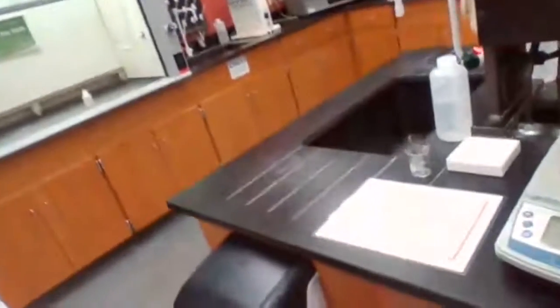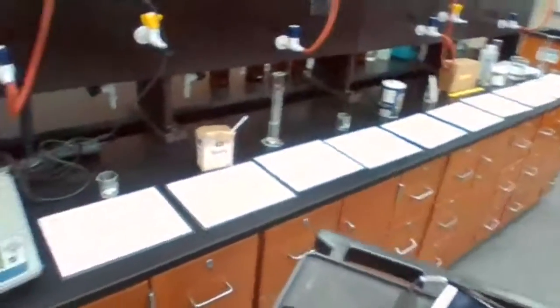The experiment is designed for you to get the data with different stations, and when you have the data for different stations, then you do your calculation following the procedure. When you look at the experimental procedure, you have to go station to station. So if you were in the lab, you would see these stations, but those stations are going to be more spread around in the lab. I have all 14 of them probably here on this bench. They put it for me. But for you, you just walk around the lab and you record those numbers.